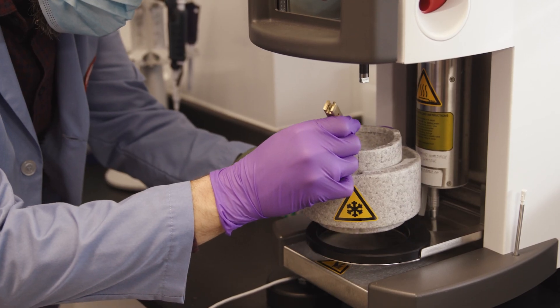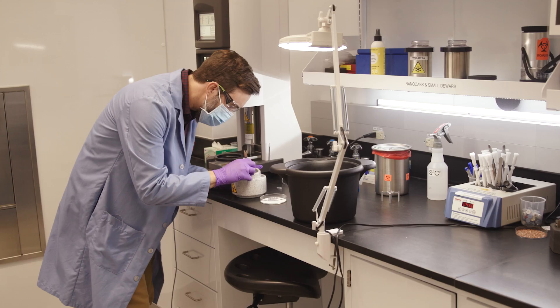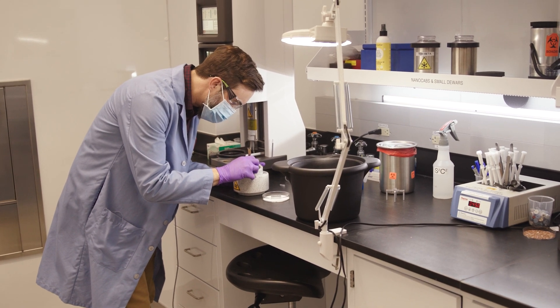The other advantage is that the program here is part of the NIH National Center program, which provides resources. The tools that are now available at the cryo-EM facility have really expanded what can be done.